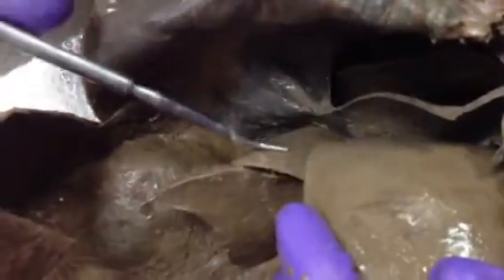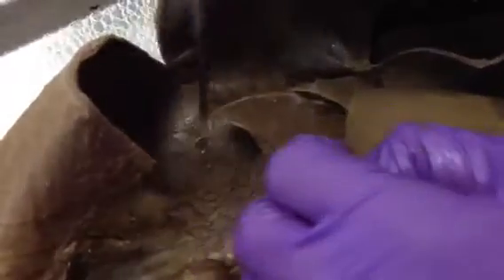It's usually kind of big, and then from there you have the right lateral lobe, the caudate lobe with the right kidney. You saw the other left kidney on the other side. And then between the caudate lobe and the right kidney, you have the hepatorenal ligament, and it's a mesentery. And then, so you came through, the esophagus comes through the diaphragm and goes to the stomach.